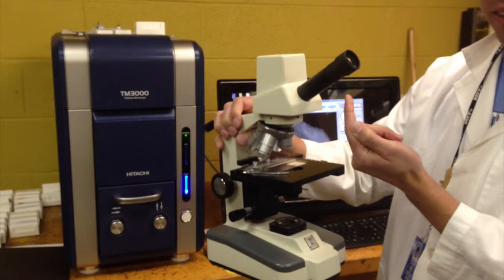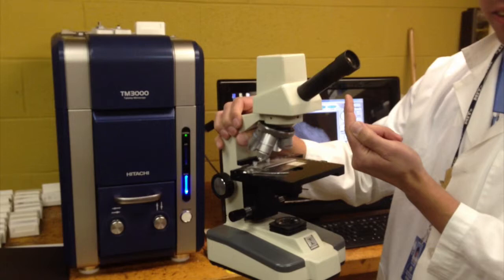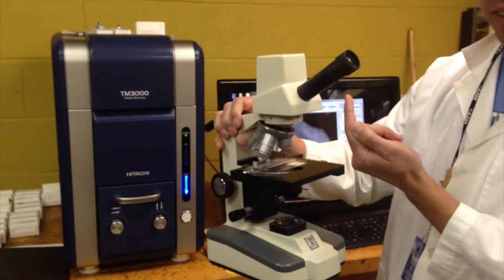We can take images, we can save video, and you can analyze many different samples — things that are biological, things that are not. This microscope is an amazing tool, and it's a lot of fun.